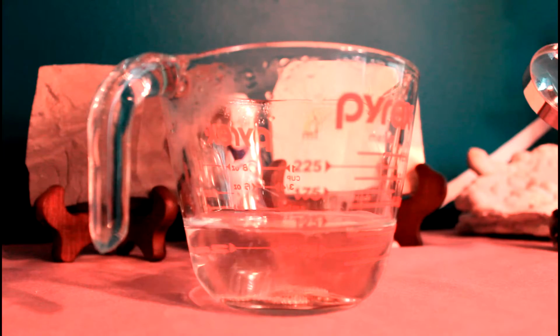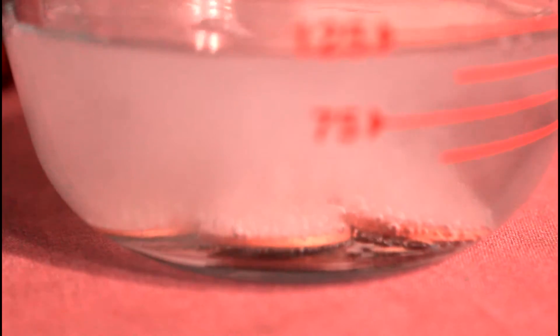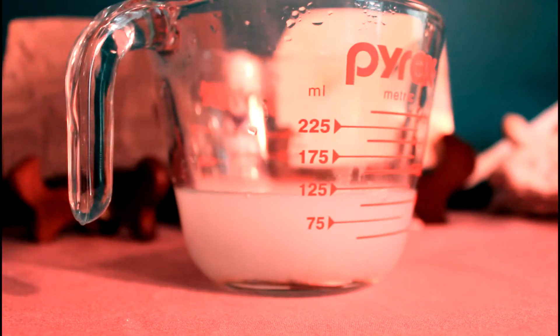Do you remember what our evidence was for a chemical reaction? Are we starting to see any already? Taking a closer look, shortly after you put the pennies in, we are seeing bubbling. So we've noticed some bubbling, but we're not done observing yet.